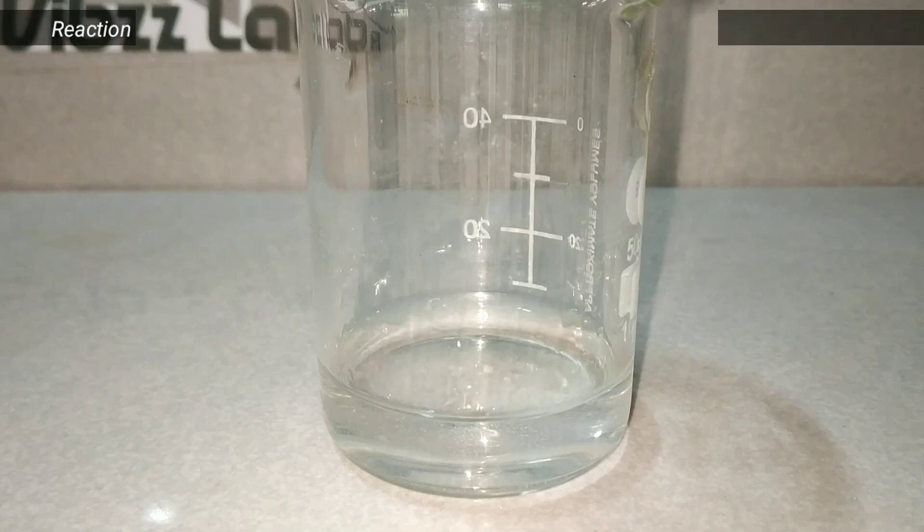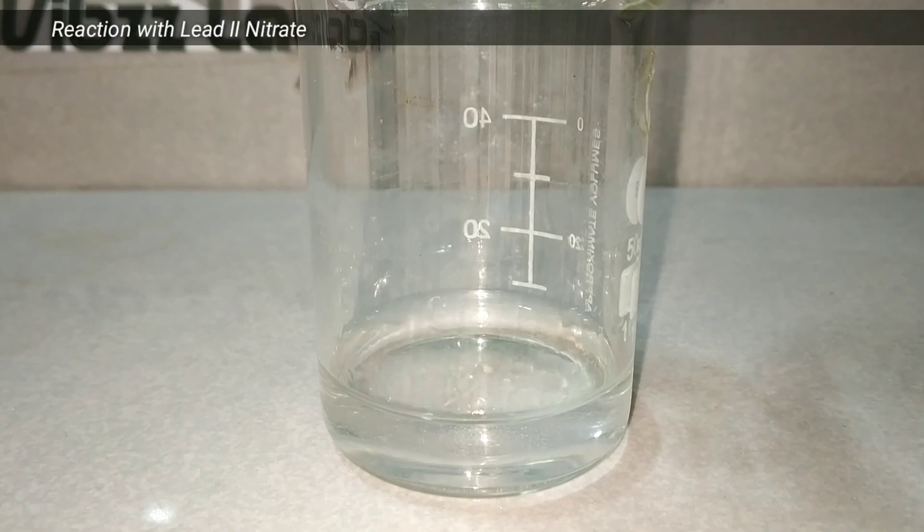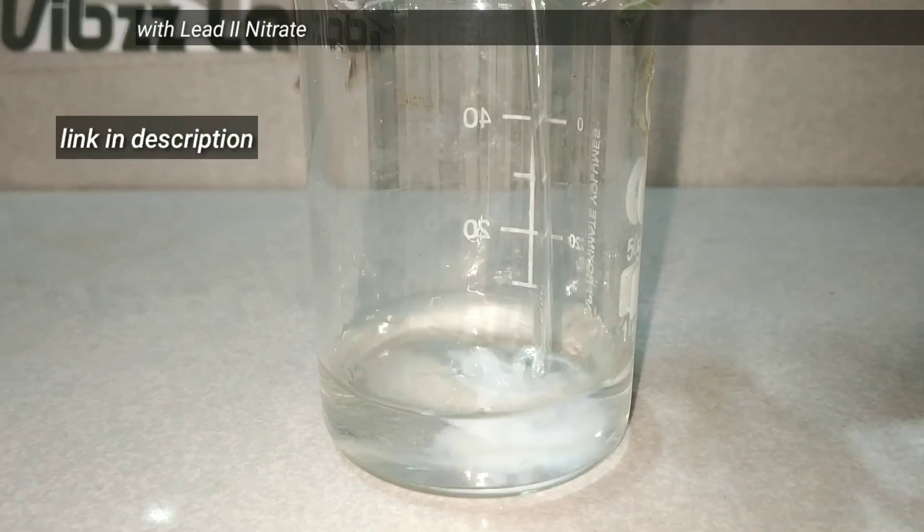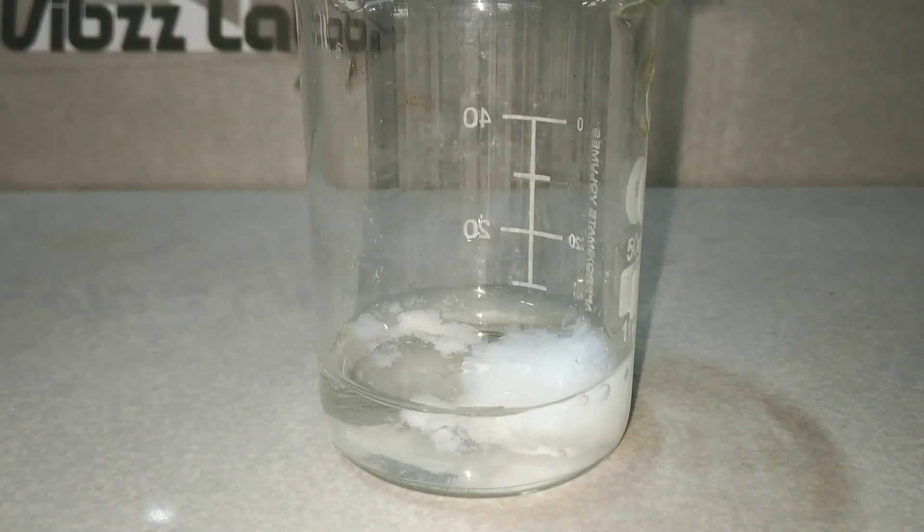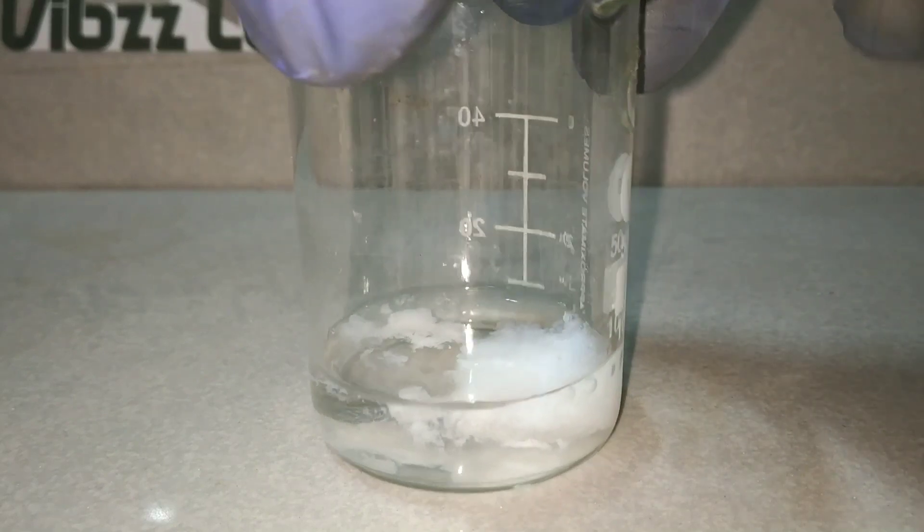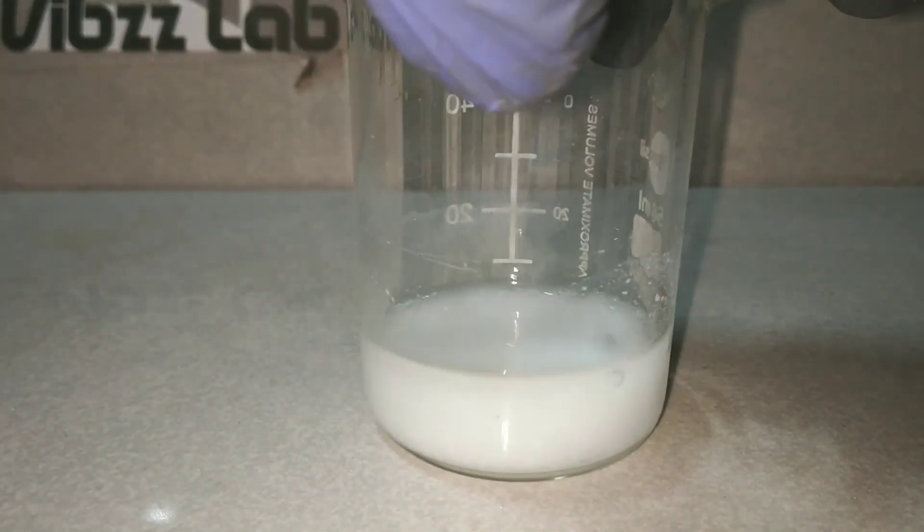I have taken about 2% lead nitrate solution. You can see I have prepared it in one of my previous videos. And now I am adding the compound into it, and you can see immediately there is formation of a white precipitate.